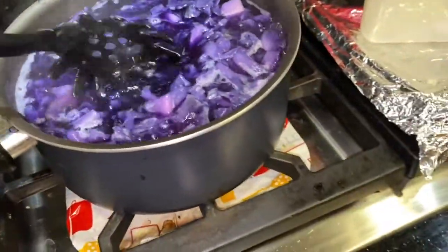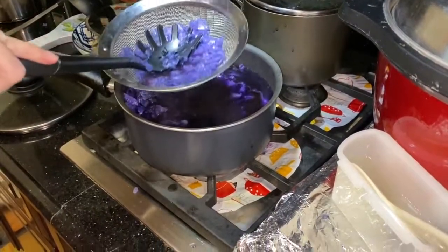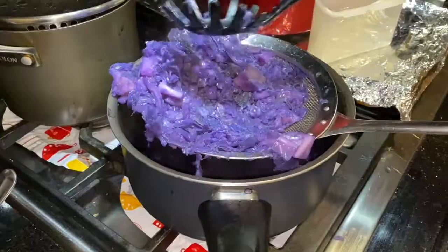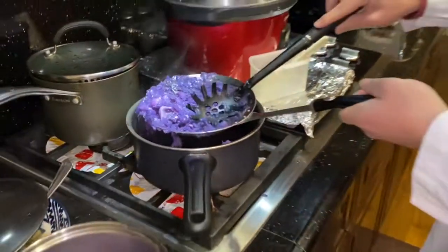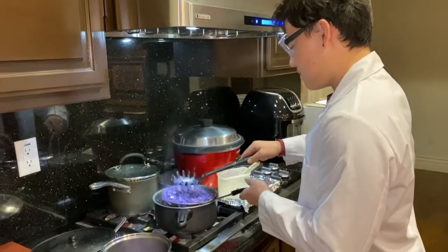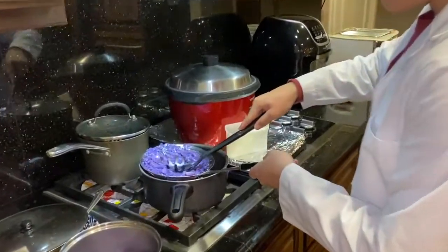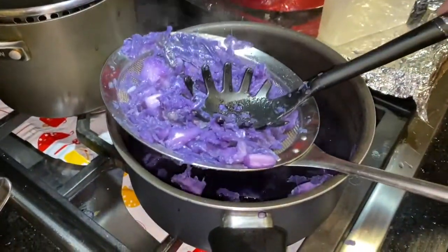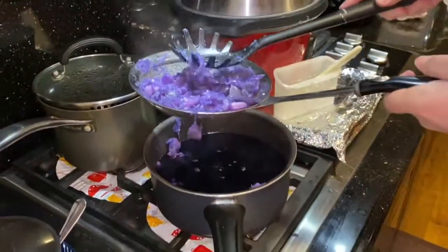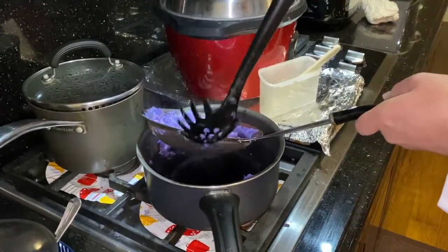We're going to turn the heat off and let it cool down. What we're doing here is a rough filtration of all the hard, large parts of the plant that didn't quite make it into the water. We're not exactly looking at nonpolar and polar groups yet, but it can be assumed that the nonpolar groups are still on the filter and aren't dissolving in the water. If you squeeze the red cabbage a little bit more, more liquid will come out, and we're just trying to get as much of that anthocyanin as possible.